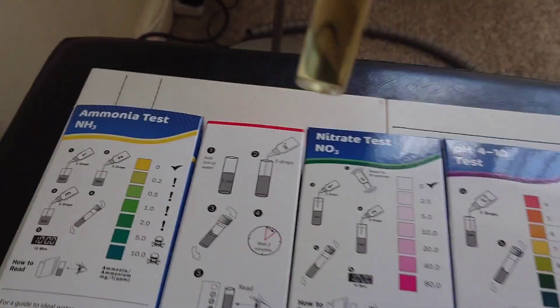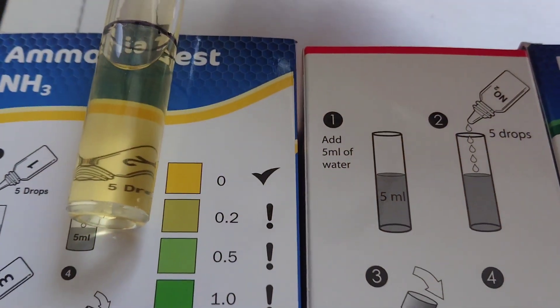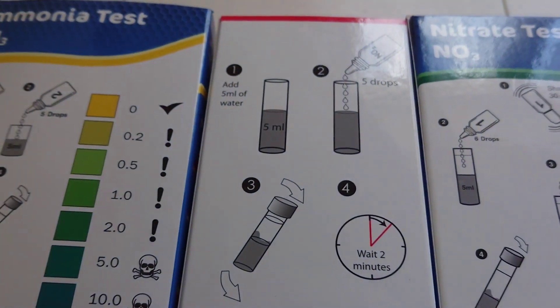Ammonia: zero. That's good. You don't want any ammonia whatsoever because that's very deadly.